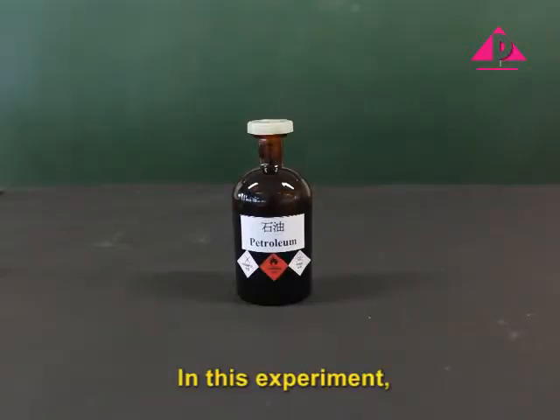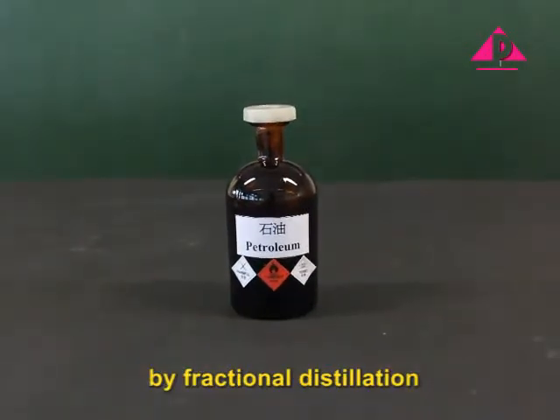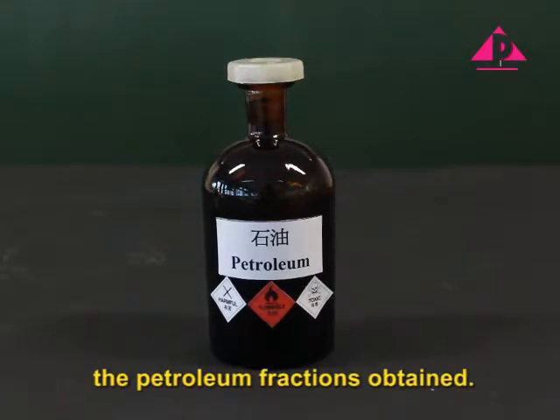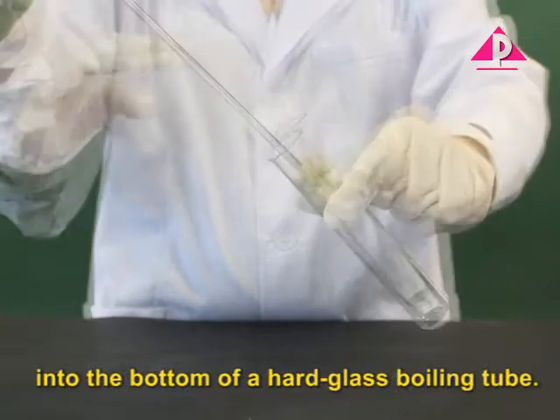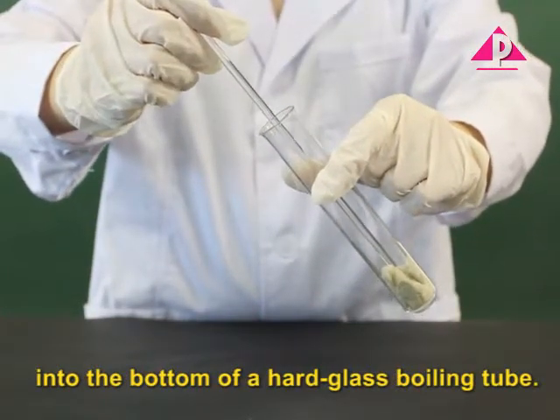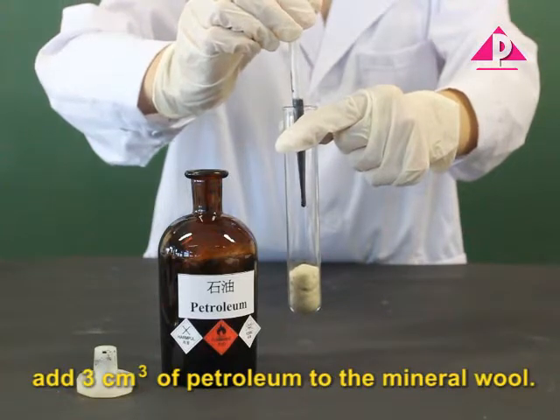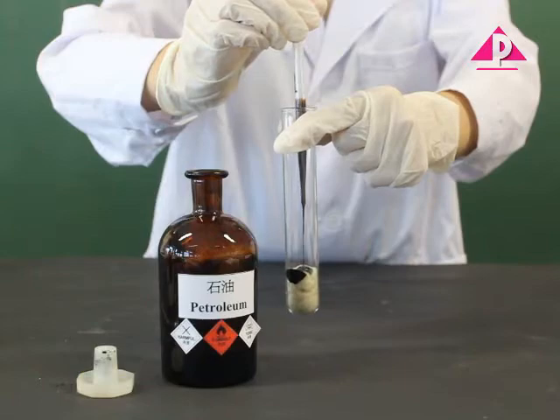In this experiment, we are going to separate petroleum by fractional distillation and study the properties of the petroleum fractions obtained. First, place some mineral wool into the bottom of a hard glass boiling tube. Using a dropper, add 3 cubic centimeters of petroleum to the mineral wool.